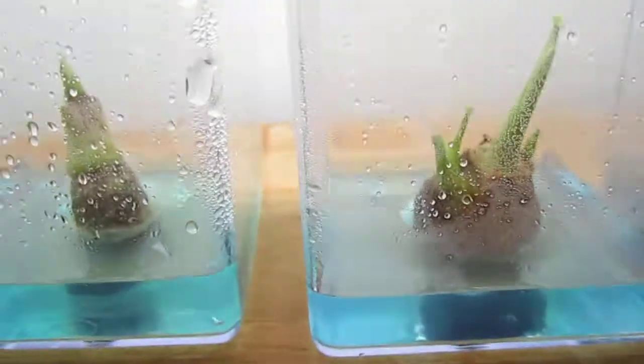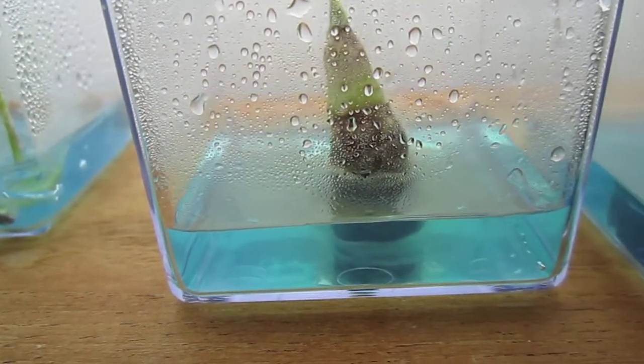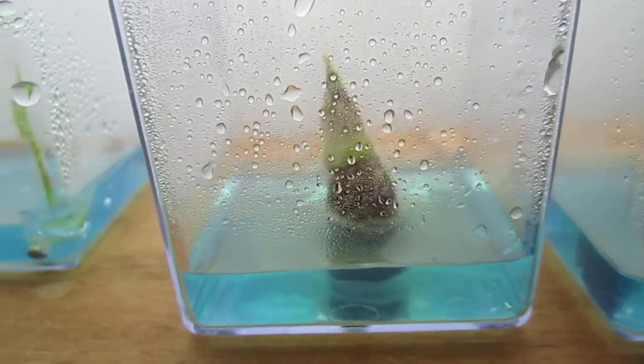After using the PPM mixture to keep down the mold — this is probably the key right there. If you can keep down that mold, look way inside there, you can see the babies. How nice that is.